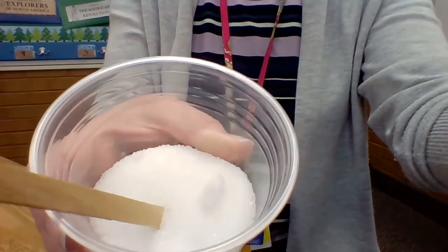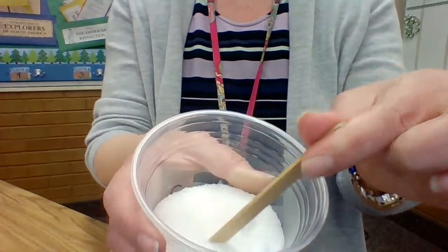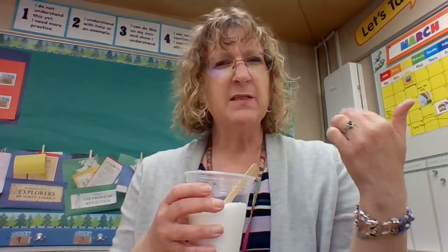I'm going to show it to the camera a little bit, and we can see it's a crystal. It's white. It's a powdery kind of looking stuff. Okay. We're not going to taste it. I might smell it a little. Smells a little sweet-ish, and powdery maybe, but that's about it. So I don't know what this is.